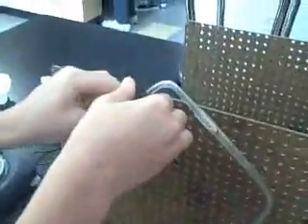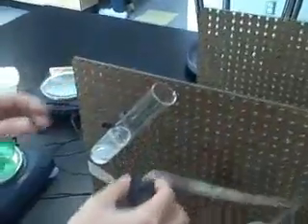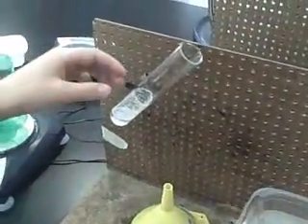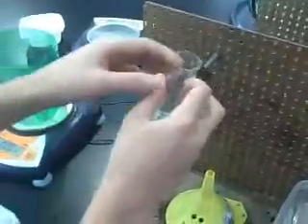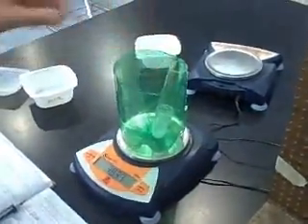Here he goes. He pulls it out very slowly, and he takes the tube out, and he puts the test tube with the dissolved Alka-Seltzer inside the container. And the mass is to be 38.44 grams.